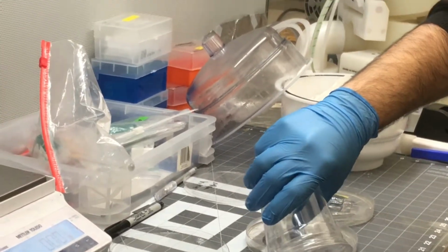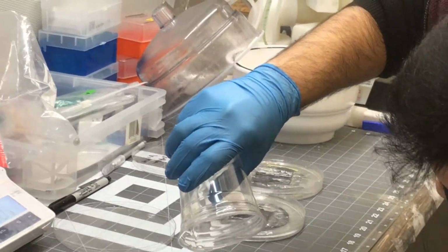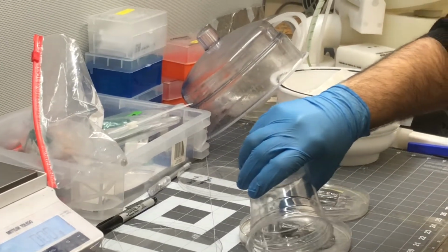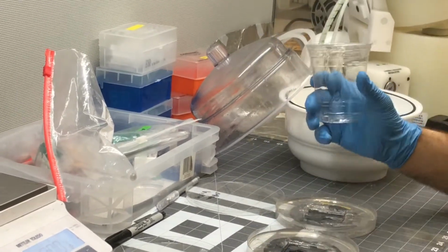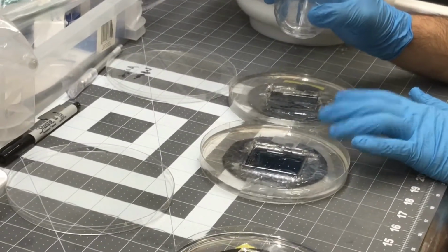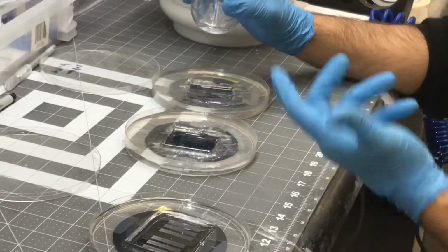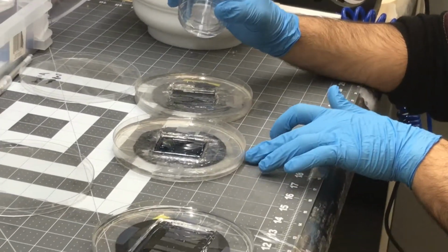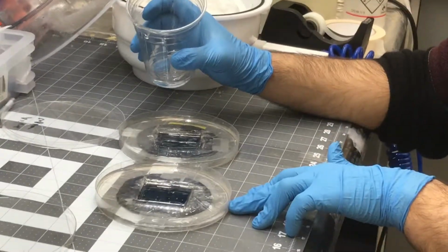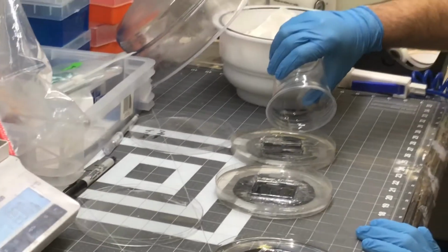So when you put this PDMS, how do you determine the height, how much it covers? The height depends on experience. You will understand. But for the PAA chip, we need a 5 millimeter height. So we fill the whole area to around 10 millimeters, so that when we fill half of it, it is around 5 millimeters.